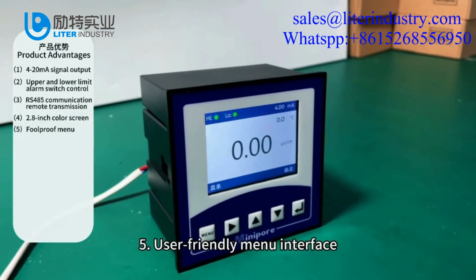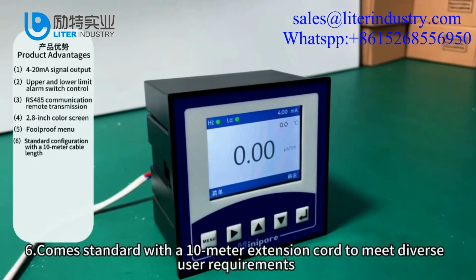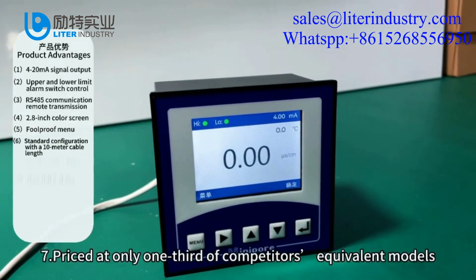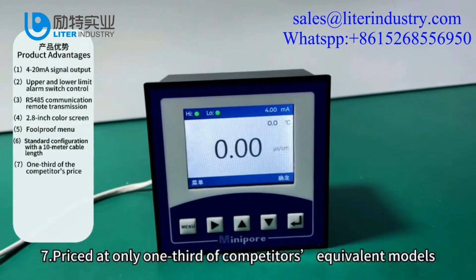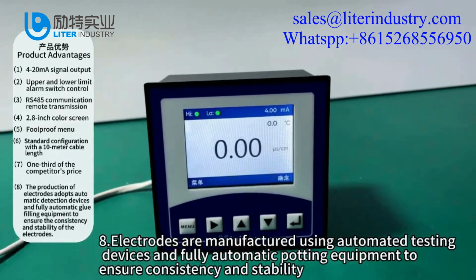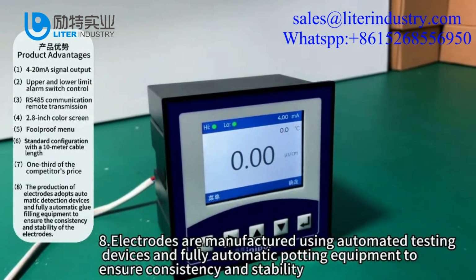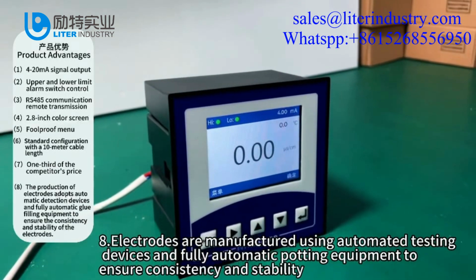5. User-friendly menu interface. 6. Comes standard with a 10-meter extension cord to meet diverse user requirements. 7. Priced at only 1/3 of competitors' equivalent models. 8. Electrodes are manufactured using automated testing devices and fully automatic potting equipment to ensure consistency and stability.